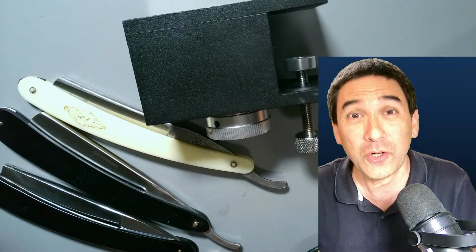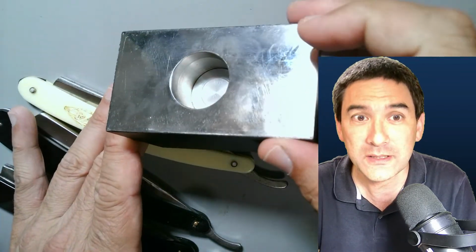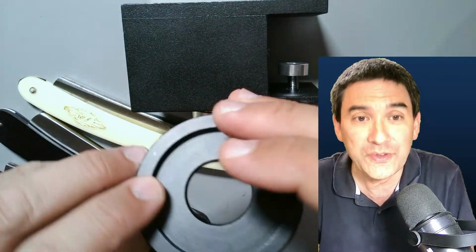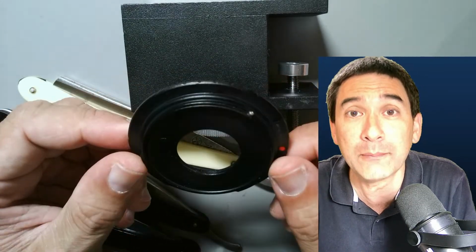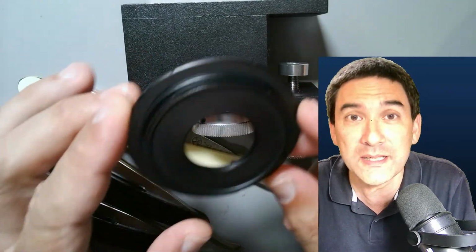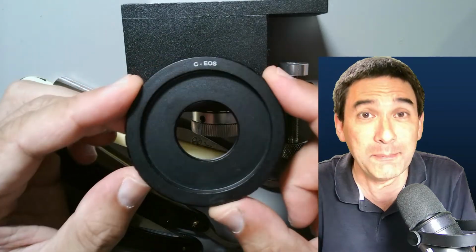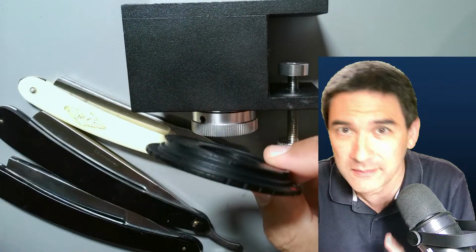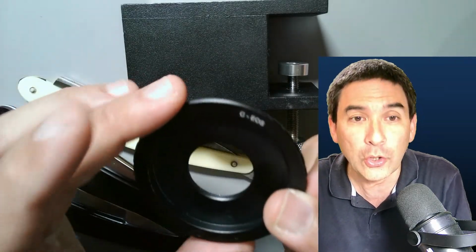Today's live stream is going to be a slightly bit more technical. Of course, I will put some stuff also under the microscope, but I do not only want to show you my new microtome that I have over here. It's a little bit unusual looking, so we'll talk about this, but I also wanted to show you this interesting little adapter ring for connecting a DSLR camera to a microscope. I just discovered this one, and really that's all you need. I cannot believe this. I'm going to make a separate video of this for the channel, but I'm excited about this, and I've gotten so many emails on how to connect the DSLR camera. There is a small caveat, but it might be indeed a very low-cost solution as well. So I'm going to talk about this as well.